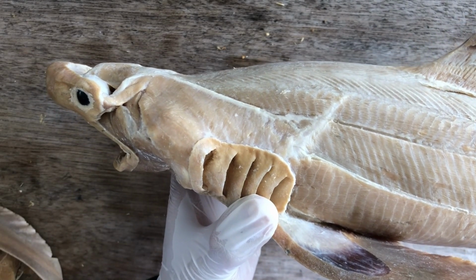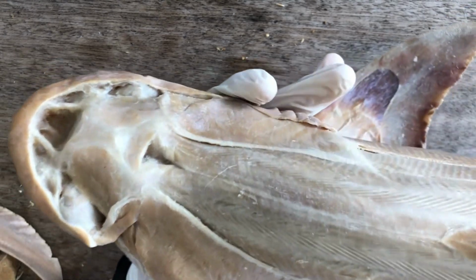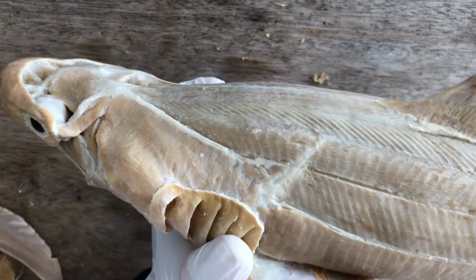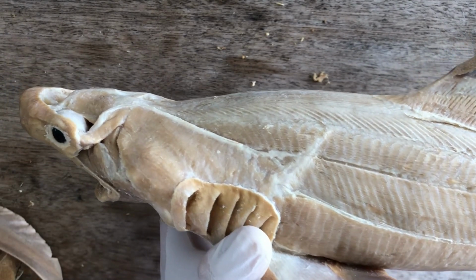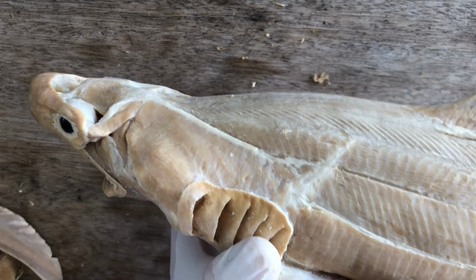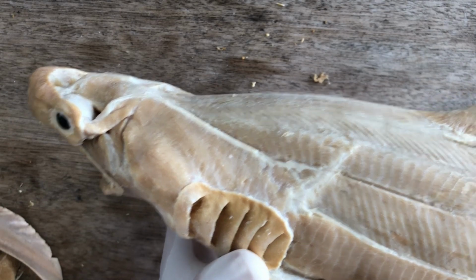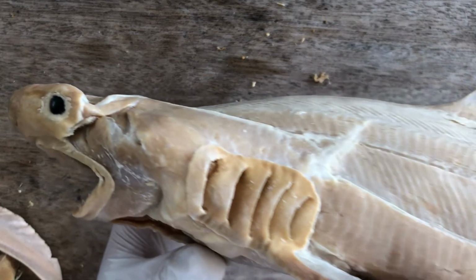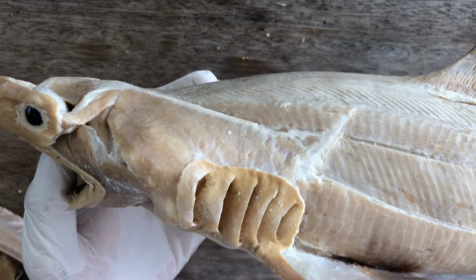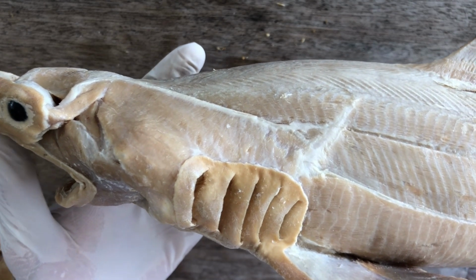And the branchiomeric muscles can be categorized into constrictor groups, the levator group, and the interarcuals. But the interarcuals, we won't study them in our specimens. They're not visible. They're not dissected. But some of the constrictors and levators are seen in our plastinated or actual formalin-preserved wet specimens of sharks, and therefore we should study them, and they have a possibility to appear in our exams and quizzes.